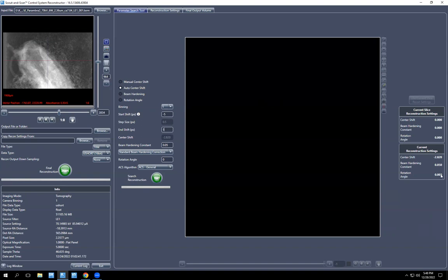I'm actually this time going to do a smaller window because we already know that the computer says it should be around -2.8. So I'm going to do -3.5 and something like 2. That way our step size is smaller and we have more control over which center shift value we like best. And hit start.